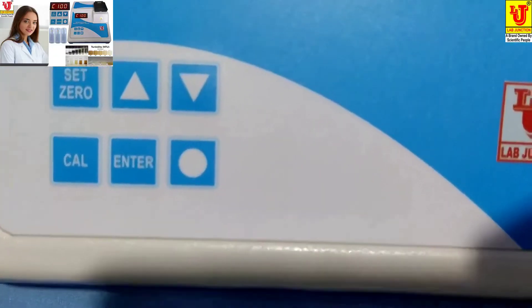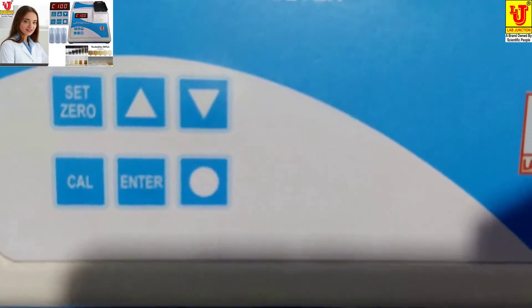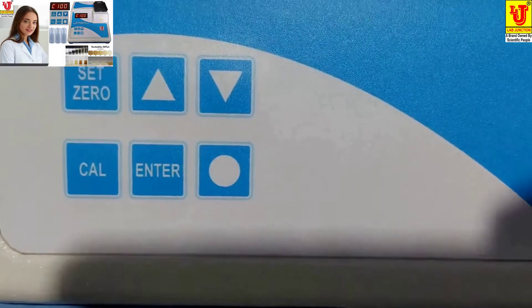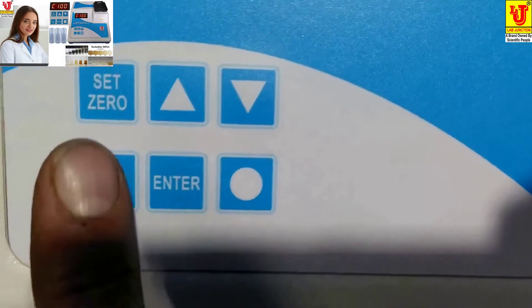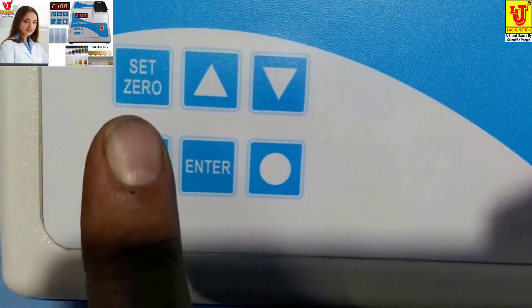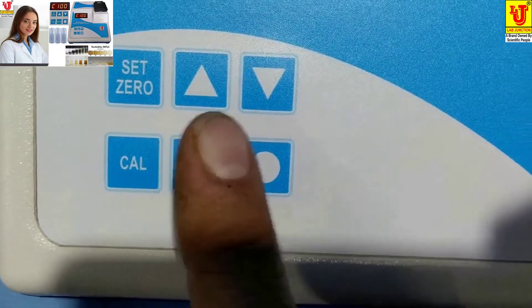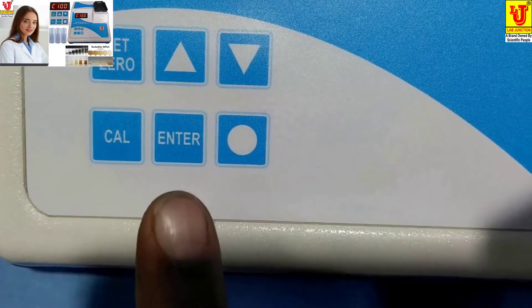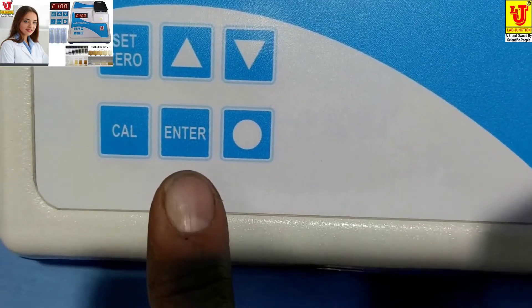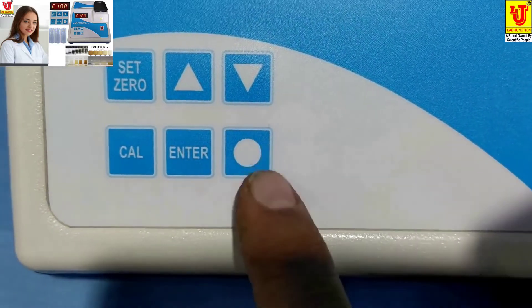Now, how to calibrate this instrument. In this keypad, this is the set zero key. These are up and down keys, this is the CAL key, this is Enter, and this is the neutral key.